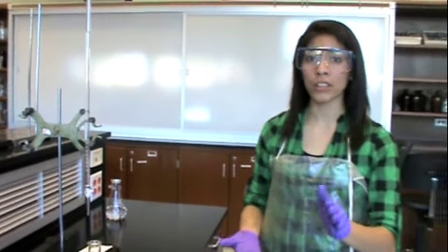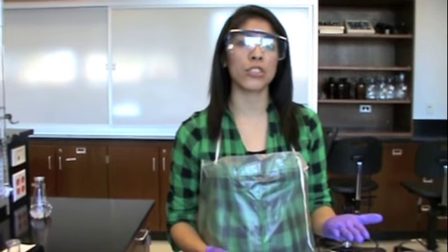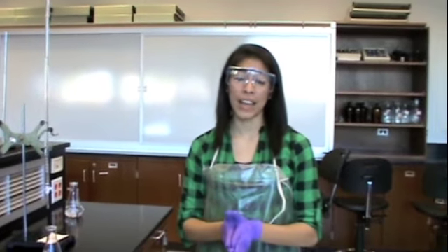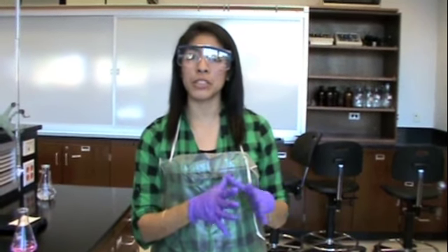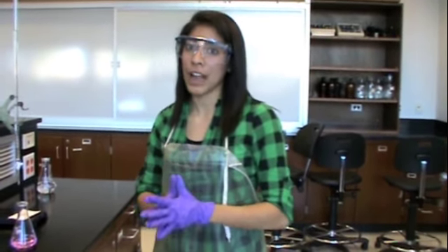Now, continuing with our procedures, we still need to titrate the vinegar solution. Now we have vinegar solution reacting with NaOH solution as well. Instead of using your KHP solution, you will use vinegar solution. Therefore, titrate using the burette. The same process. Like I mentioned before, you have everything you need. You will just do a little bit of stoichiometry to find the molarity of NaOH, which will help you with calculations for the molarity of your acetic acid.